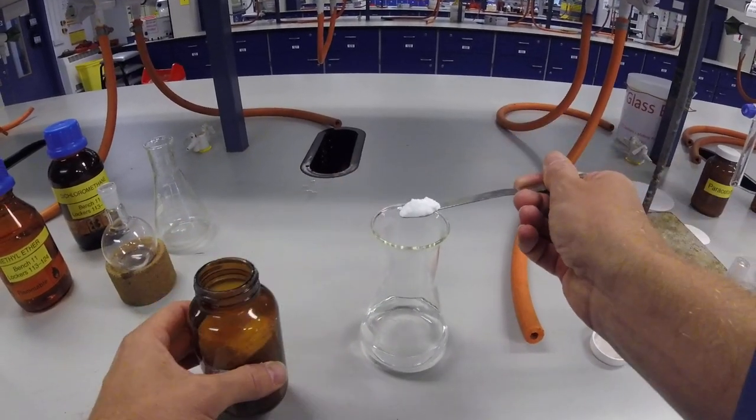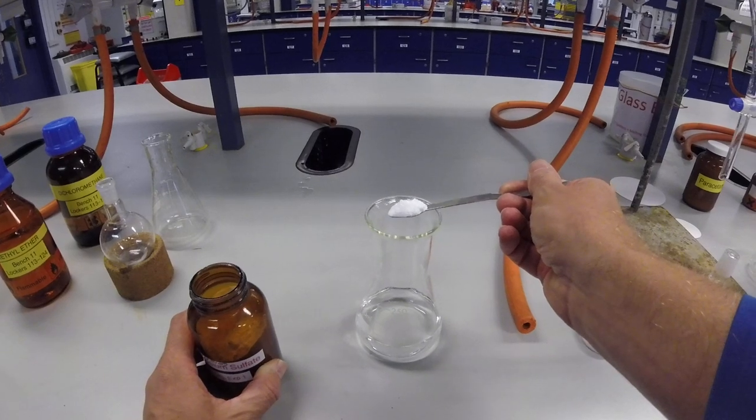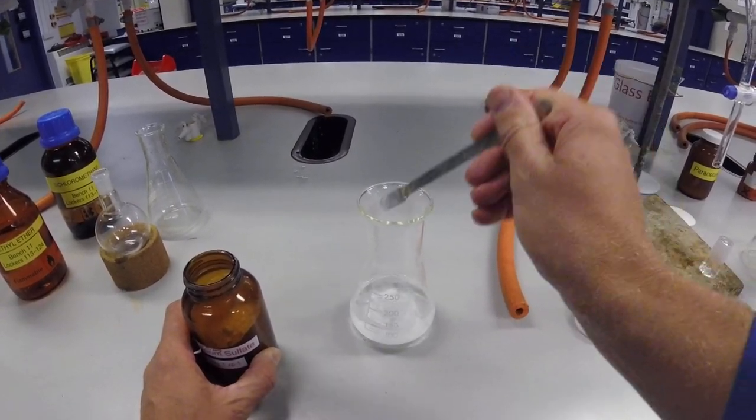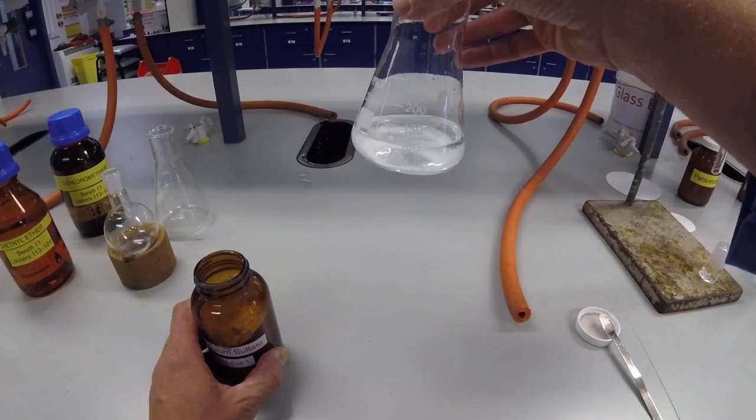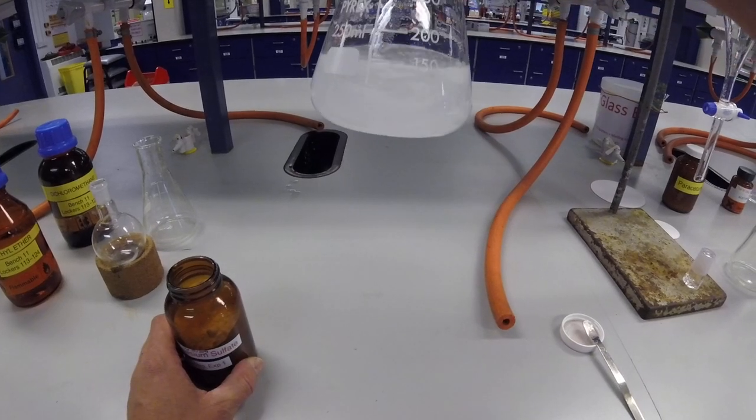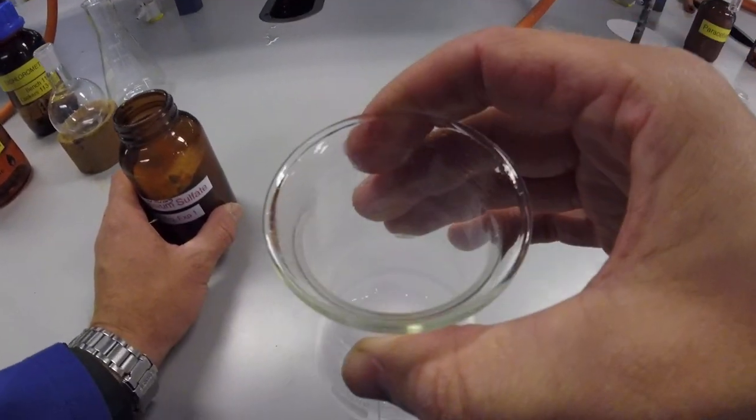The question we're always asked is how much magnesium sulfate is required, and the answer is enough. You need to add the magnesium sulfate until you can tell that all the water has been removed. And you can tell that, because when you first add the magnesium sulfate, have a look in there.